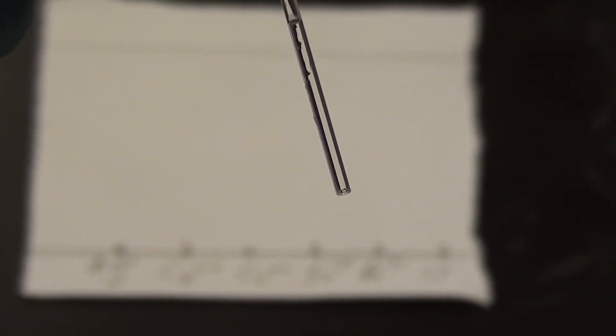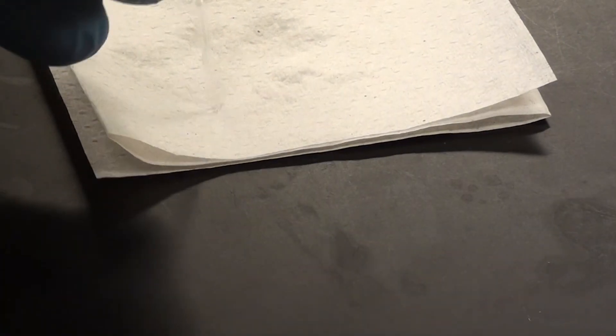Now this particular capillary tube is one of the larger variety. And I recommend if it's a large capillary tube to go ahead and just empty a little bit out onto a paper towel and that's what I'm going to do over here. And that just means tapping it on the paper towel. Now there's still sample in there of course, but it gets any big drops off the bottom that might cause a large diameter spot when I put it on the plate.